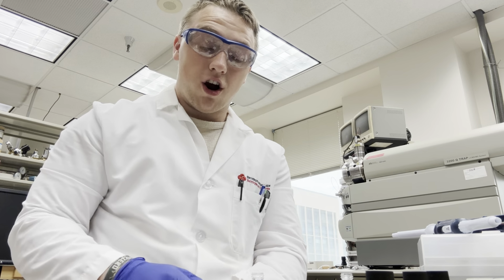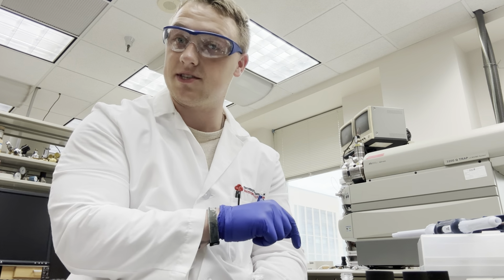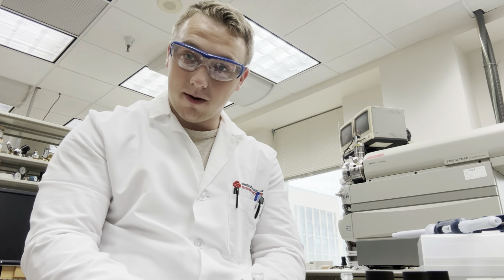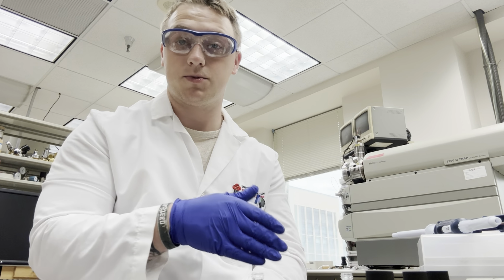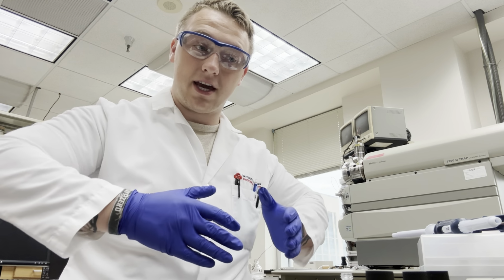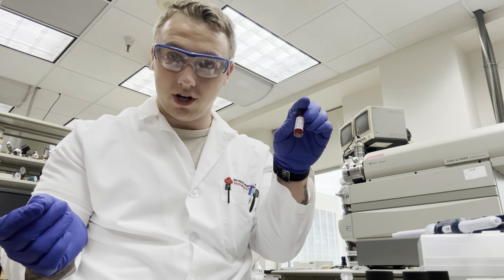So now we have our Nile red 5 milligrams per milliliter solution, and we're going to get it down to our final concentration, like we've been saying all along, to 1 milligram per milliliter solution. So now this is purely a fraction game. So we want to get it to 1 milligram per milliliter from 5 milligrams per milliliter. We want to do a 1 to 5 dilution, which means essentially we take any number and we make our 5 milligram per milliliter solution in this new solution a 1 in 5 ratio, right?